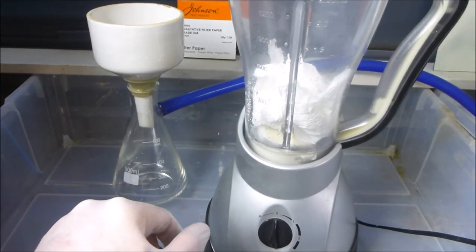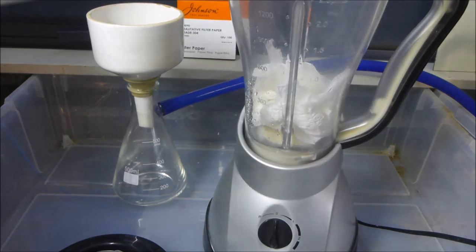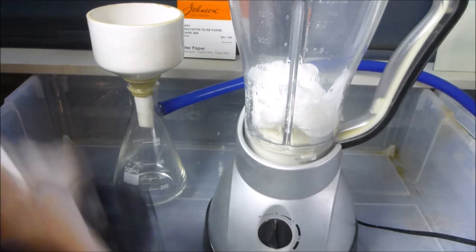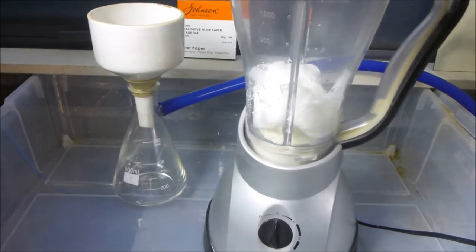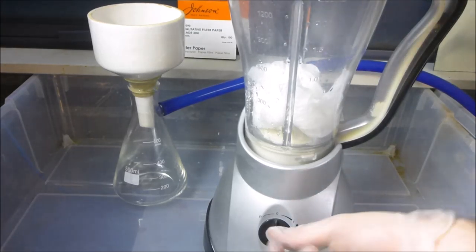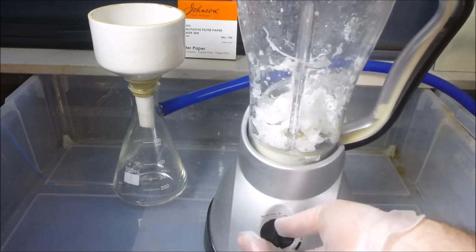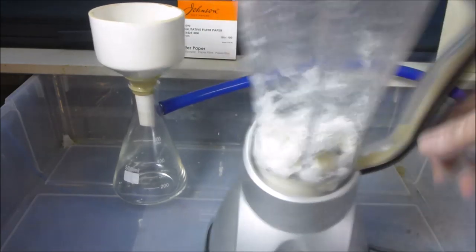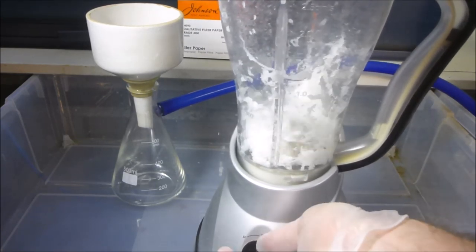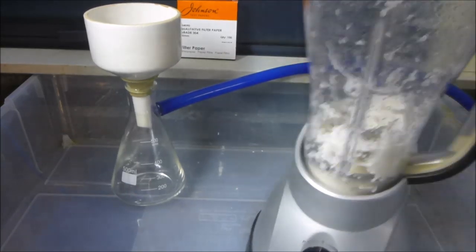Let me give it a little bit of water. Not too much, just enough. What we're looking to make is a mushy paper mache type consistency in there. So hopefully this works. Yep, seems to work. So you see that it's chopping the paper towel up pretty fine. It's looking pretty good, nice and quick.